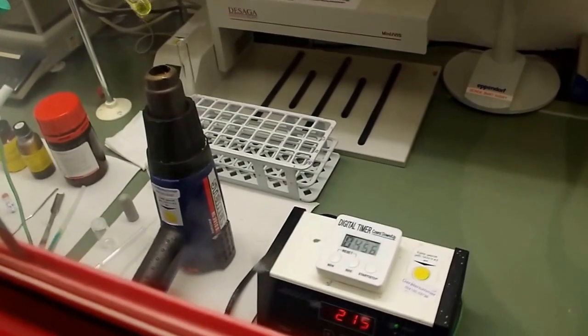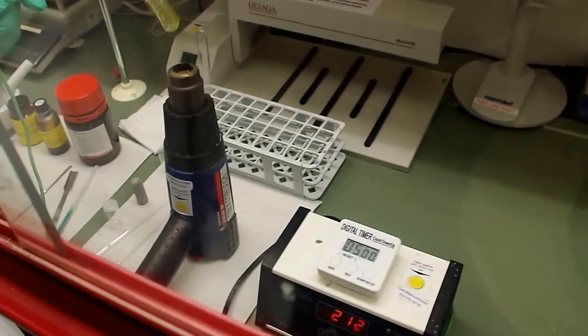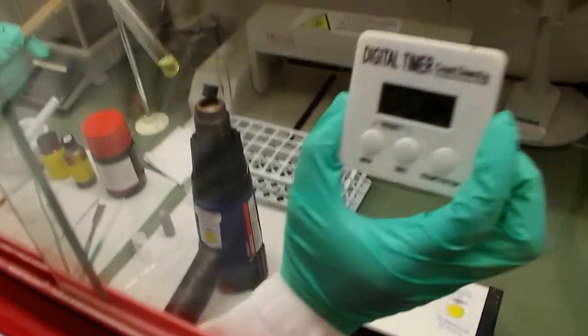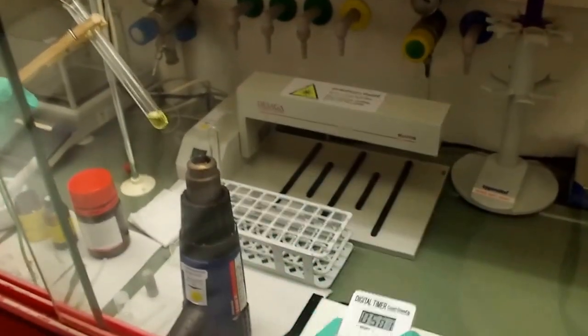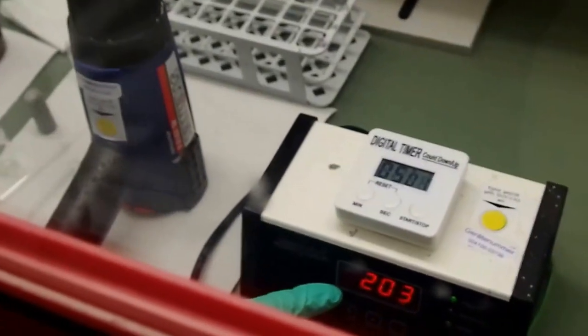So 4, 3, 2, 1, 0. 5 minutes over. Alright, so 5 minutes, 200 degrees. Okay.